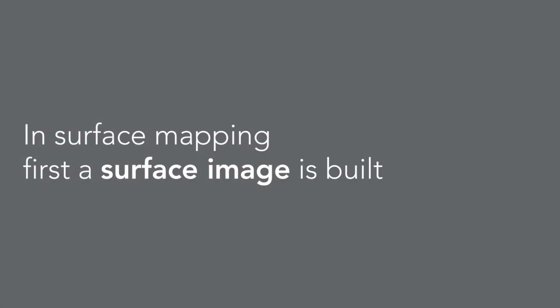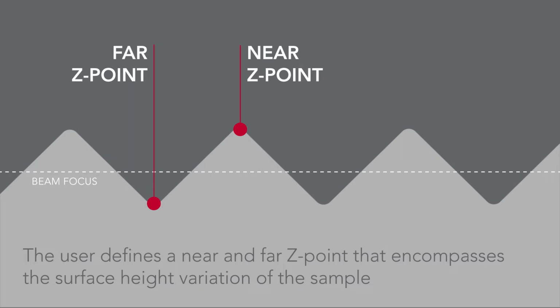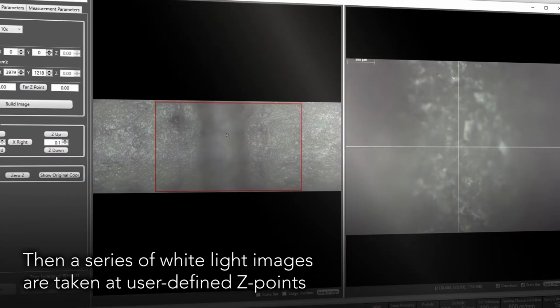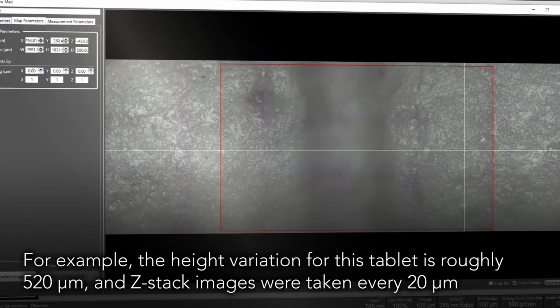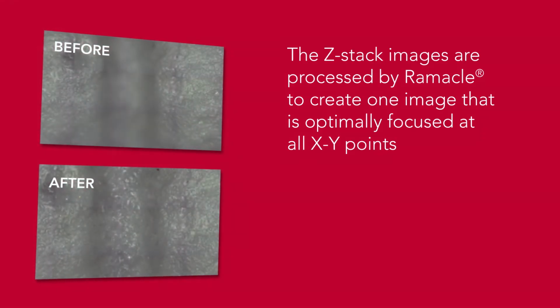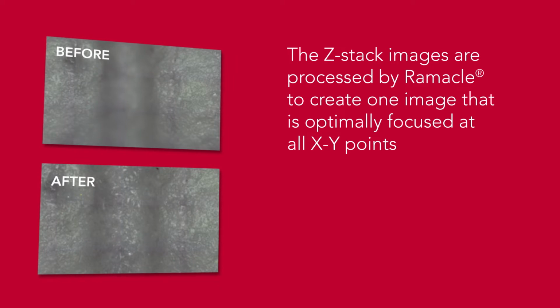The solution to deal with these sample types in Ramacle first builds a surface image. Far and near Z points are defined by the user based on their sample's lowest and highest points of focus. This range encompasses the total surface height variation. The user then defines their Z resolution, and a series of white light Z stack images are taken. For our pharmaceutical tablet, the height variation of the surface is 520 microns, and Z-stack images were taken every 20 microns. These Z-stack images are processed in Ramacle, creating one image that is optimally focused at all XY points.